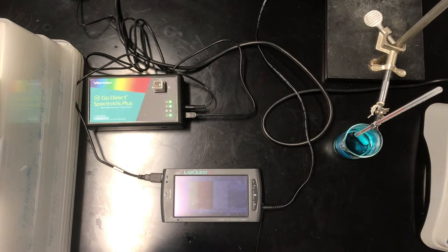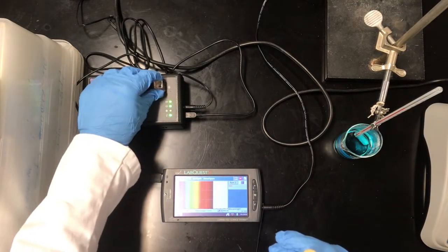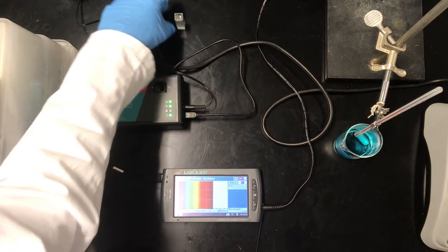I've gone ahead and heated this to a temperature of about 70 degrees C right now, and I've set up a spectrometer to record a visible spectrum. This is just a deionized water blank.